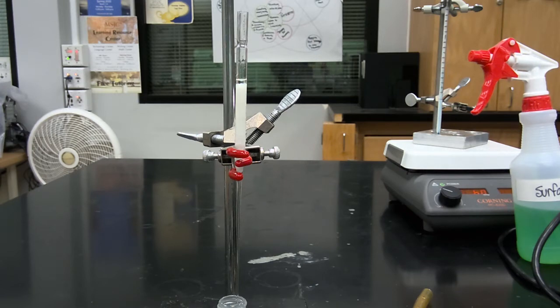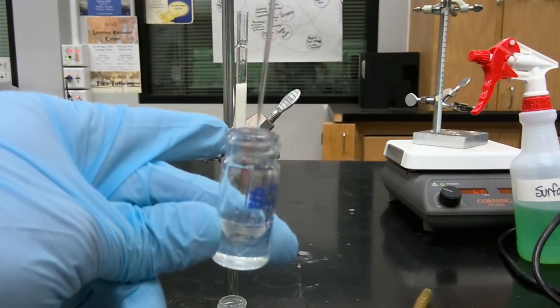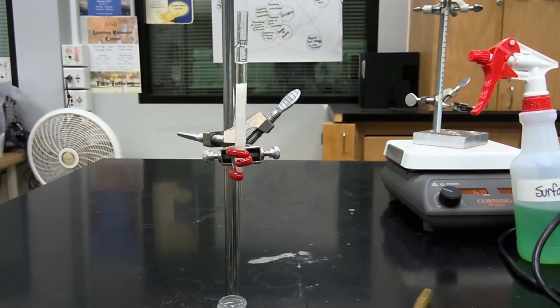So we'll do another rinse with another 0.5 milliliter aliquot. So we have our crude reaction flask, we're going to collect our product mixture, and then we're going to load it onto our column. We're going to allow this portion to elute through the column, and then we're going to rinse and allow an additional 1 milliliter of dichloromethane to elute through our column.